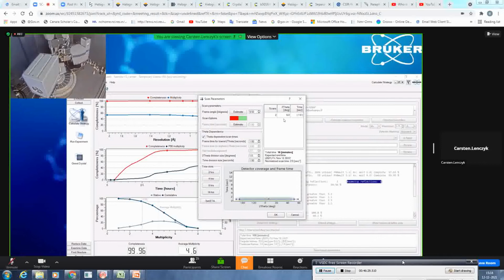And to get reasonable data in all shells, there is this 2 theta dependent scan time function. Because if you have different theta positions, it would extrapolate from the lowest 2 theta times. Of course, you need less exposure time because the reflections are more intense. And for the higher 2 theta positions, you could then, for example, go to 10 seconds, and it will extrapolate if you have different theta positions from the lowest to the highest exposure time. Since we only have 1 2 theta position present, this function, and you see here it's grayed out, would not make any difference to the parameter settings we have here. You see here it will already be done in 16 minutes.